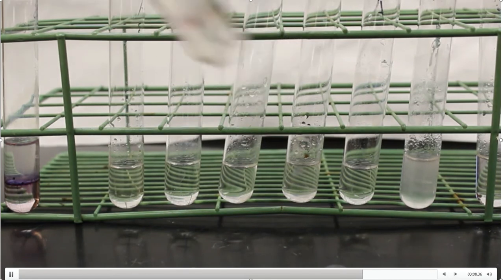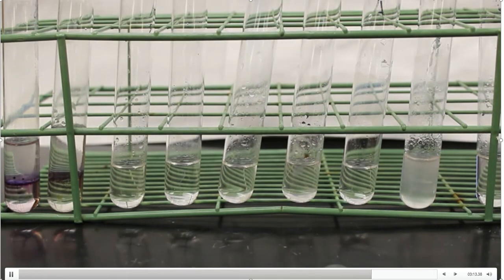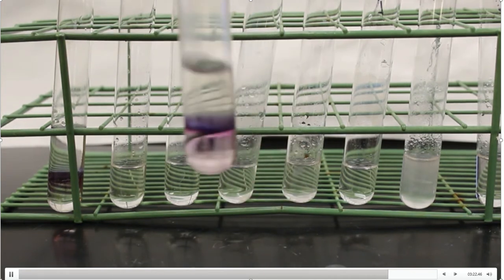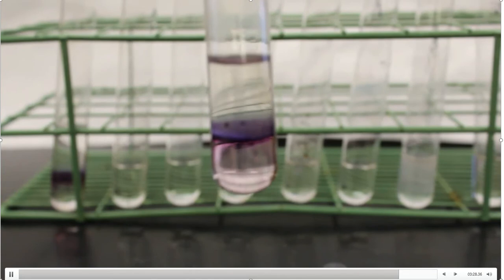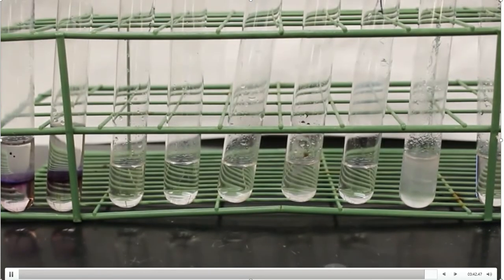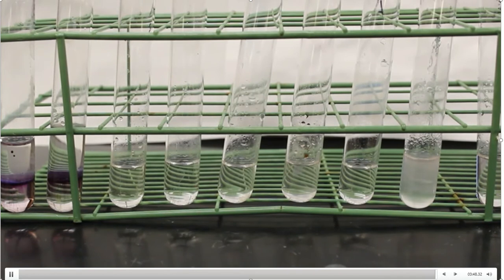There's my second tube. We'll just kind of wait and see what happens. And folks, here's the first one. I think you can see there is an observational change happening here — something is going on in that test tube. This is the Molisch test, and it's going to help me determine if something is a carbohydrate or not. I'm going to continue to add sulfuric acid and then we'll come back and pick up from there.